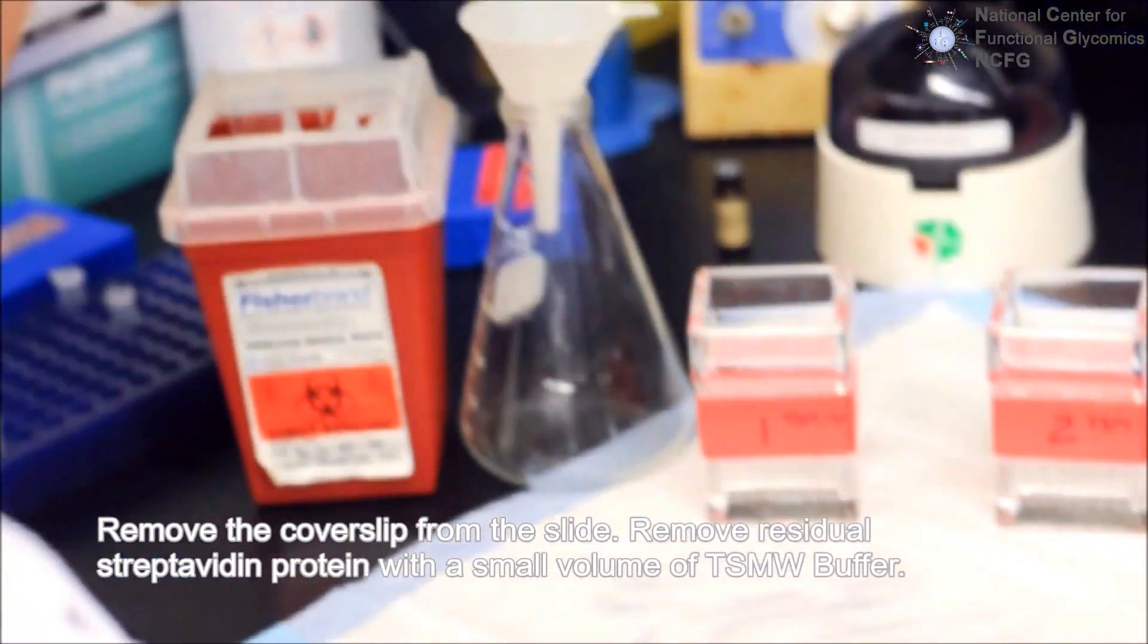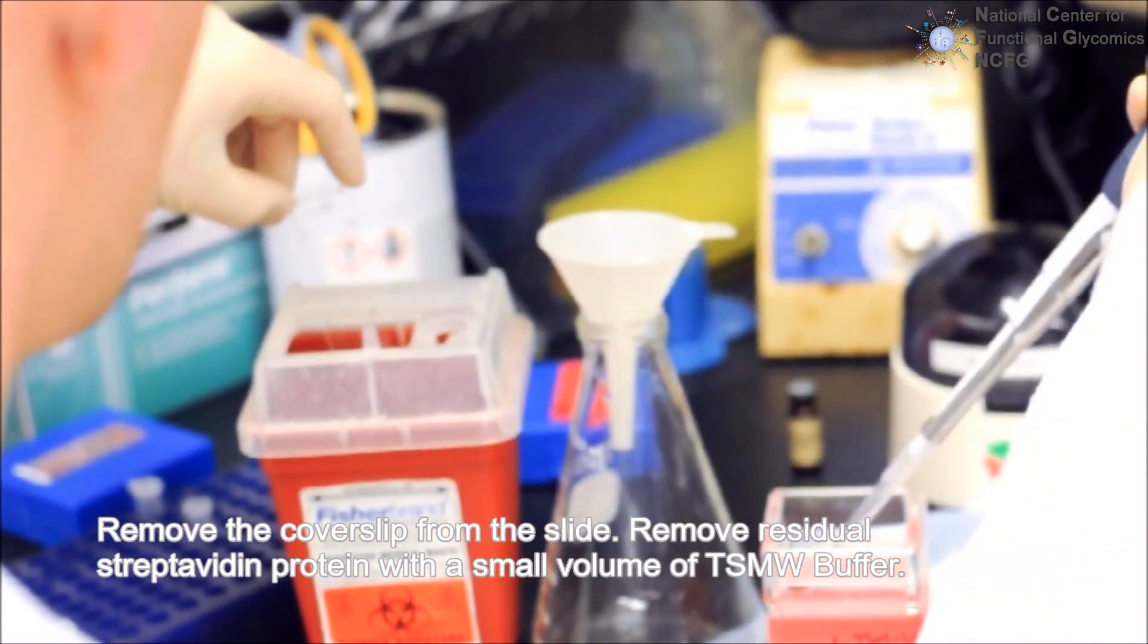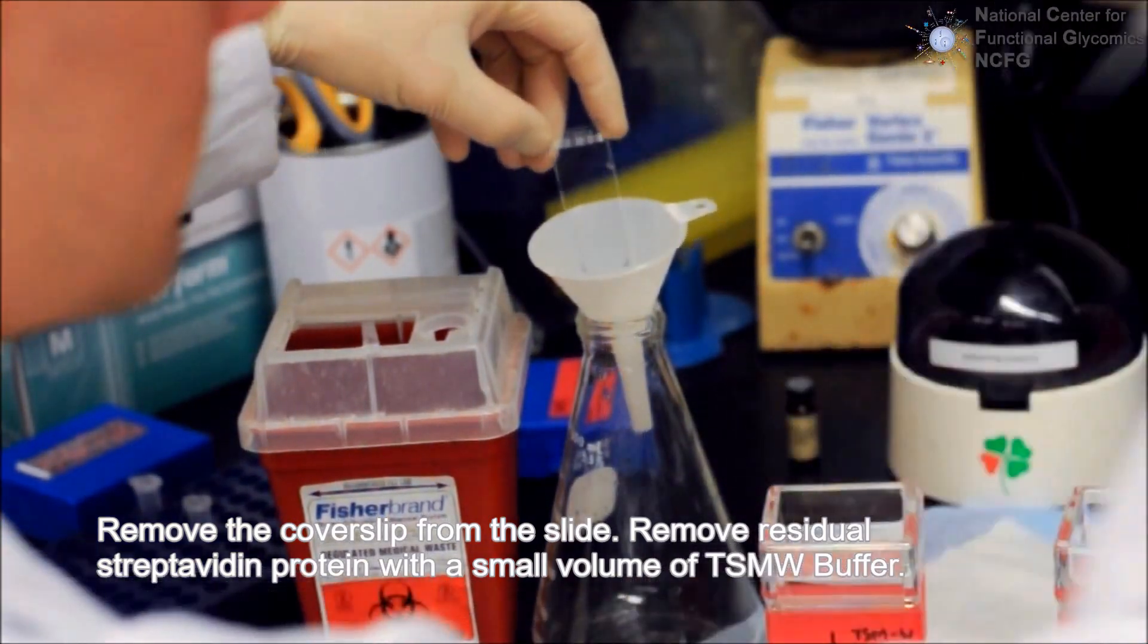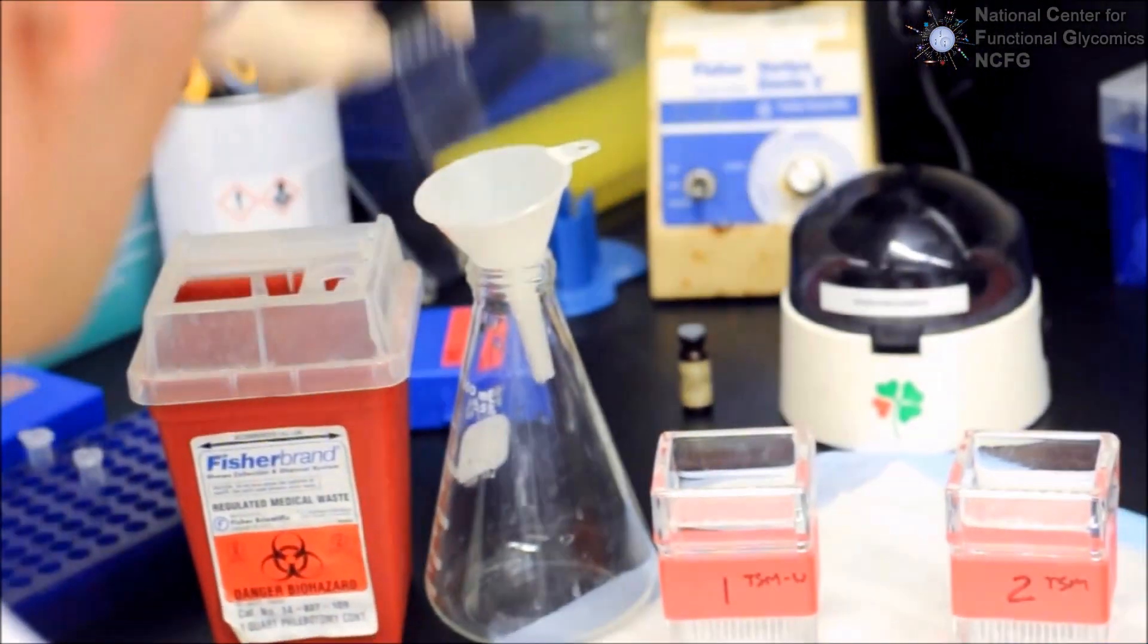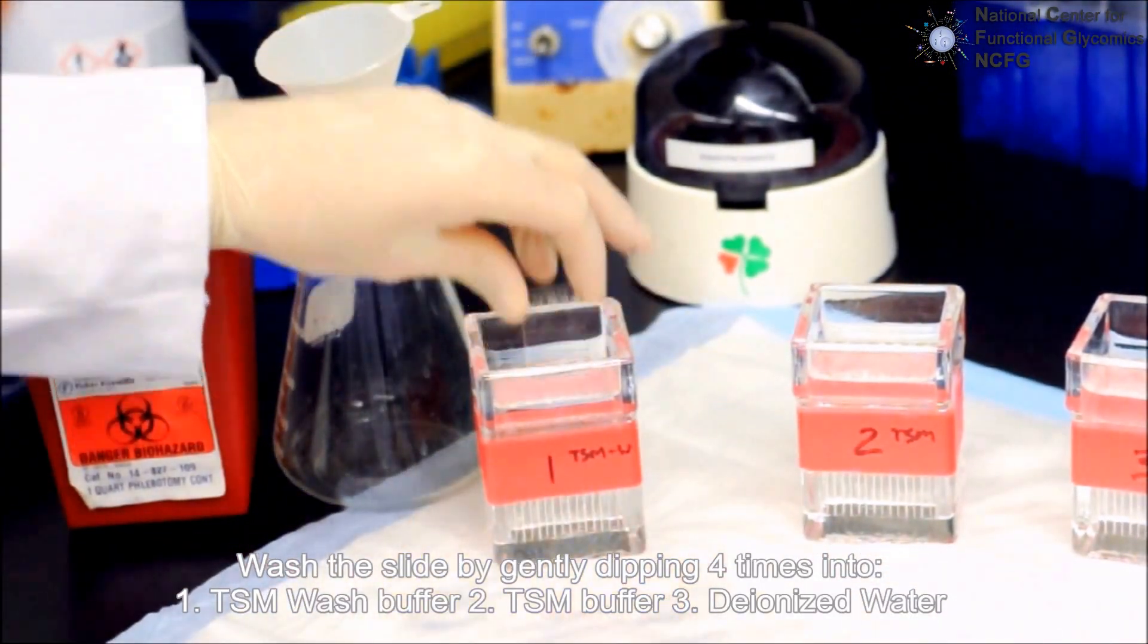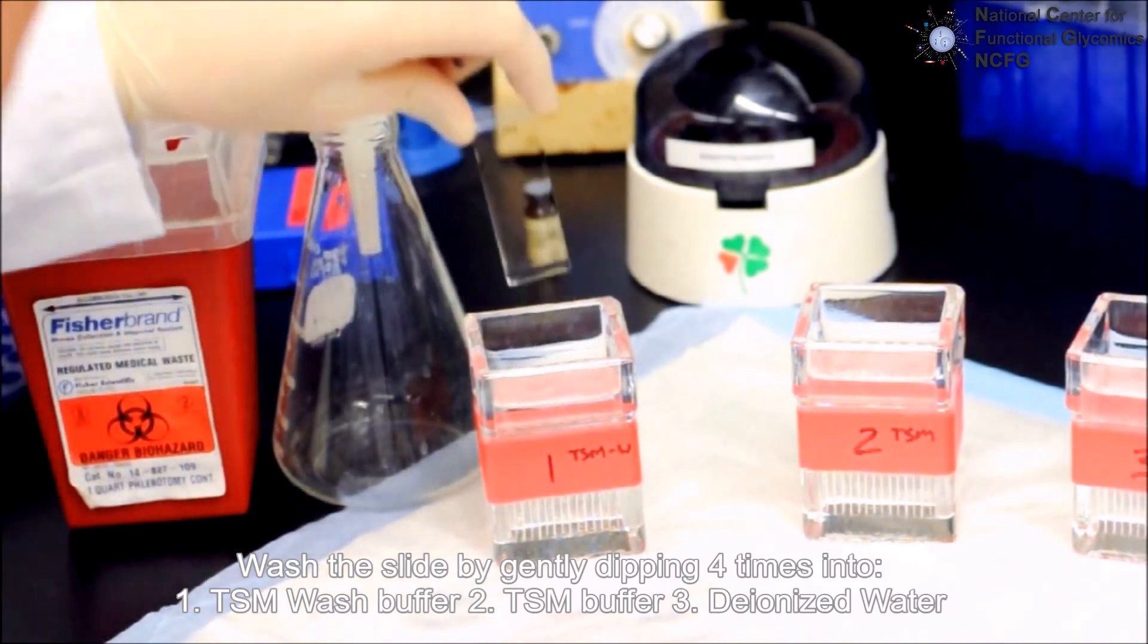Remove the cover slip from the slide. Immediately remove residual protein with a small volume of TSM wash buffer. Wash the slide by gently dipping four times each into TSM wash buffer, TSM buffer, and type 1 water.